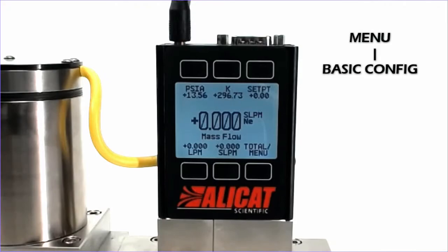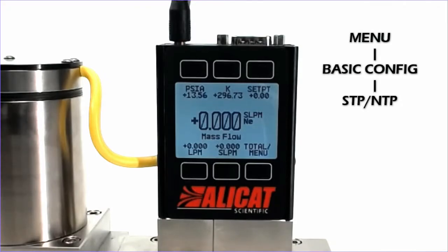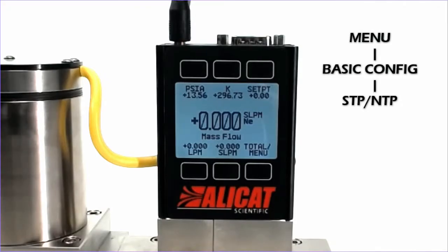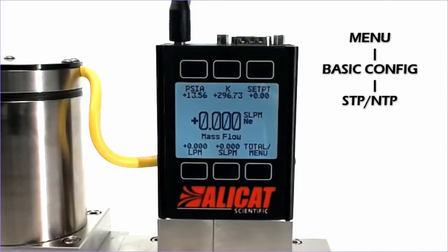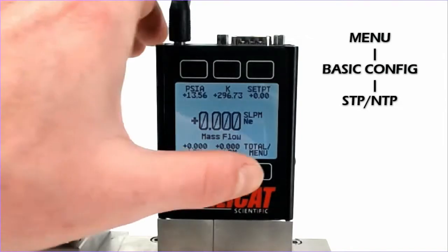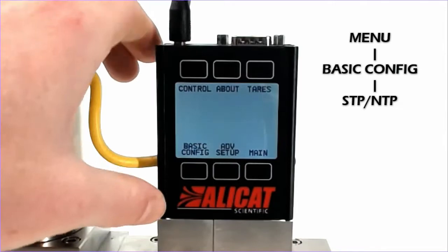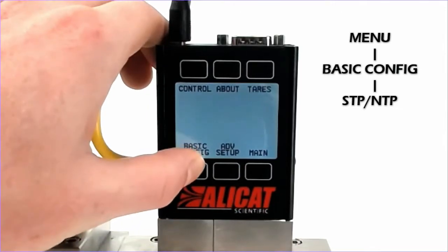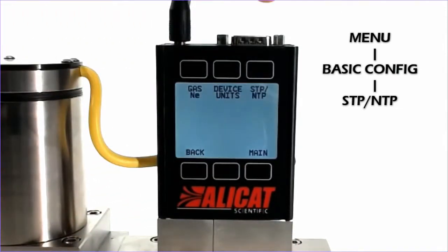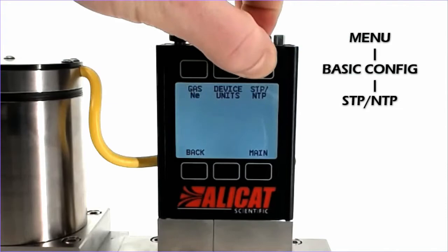In order to change the standard temperature and pressure, or normal temperature and pressure — STP or NTP for short — we will hit Menu, Basic Configuration, and STP NTP in the top right here.